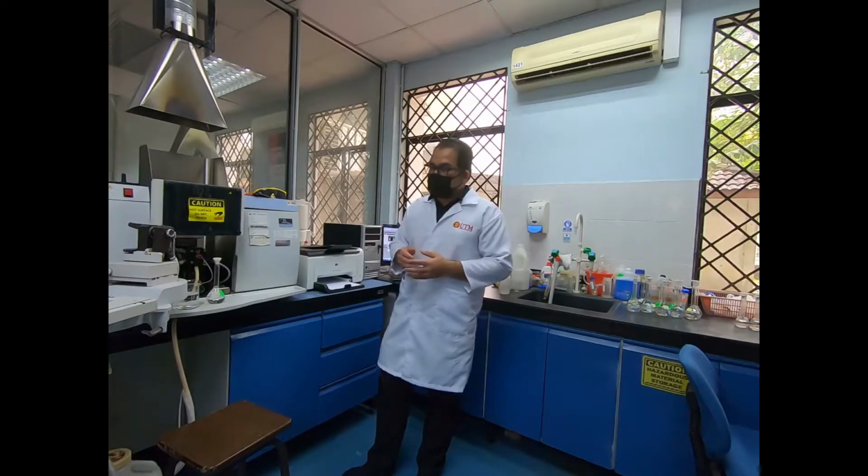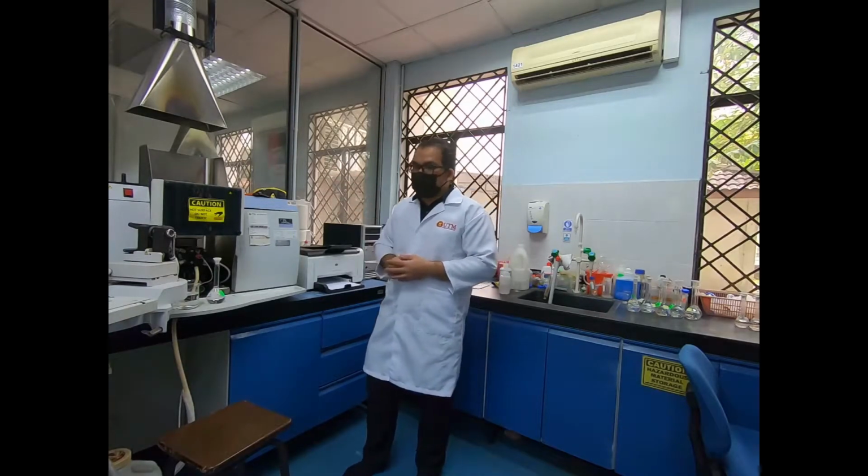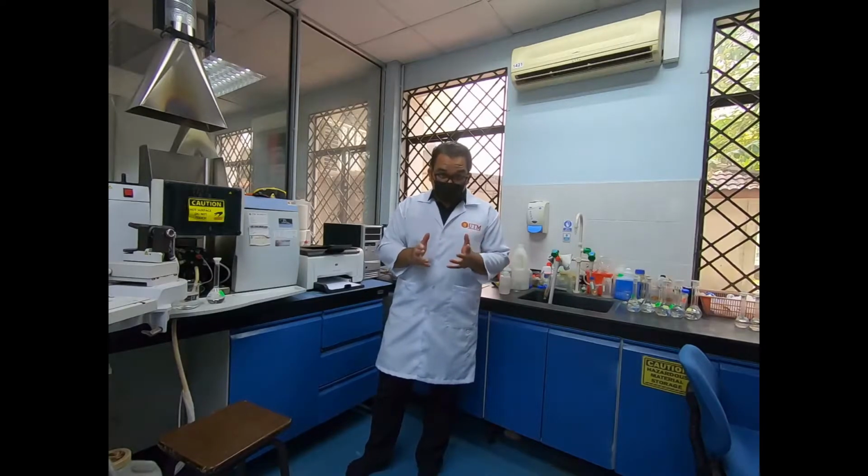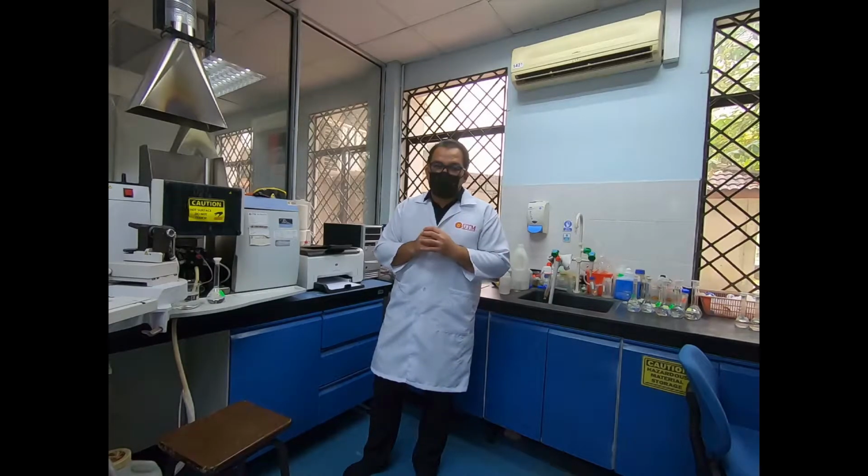Electrons of atoms in the atomizer are promoted to higher orbital for a short amount of time by absorbing a quantity of energy at a given wavelength. This amount of energy or wavelength is specific to a particular electron transition in a particular element. This gives the technique its elemental selectivity.